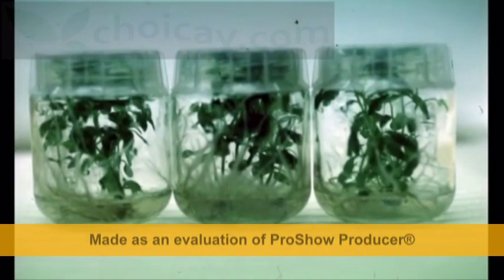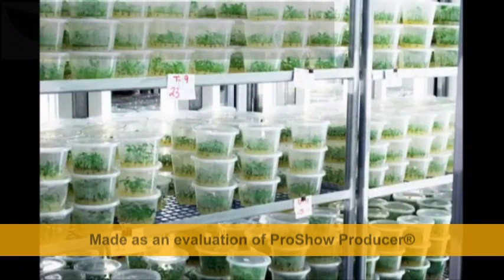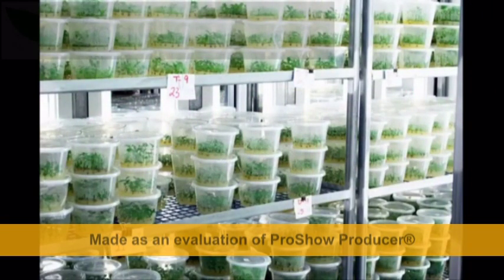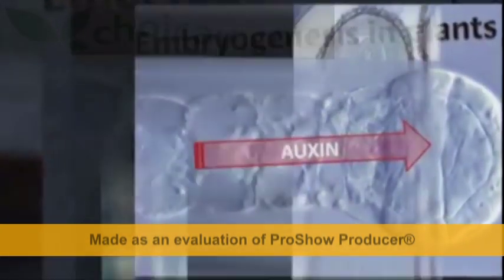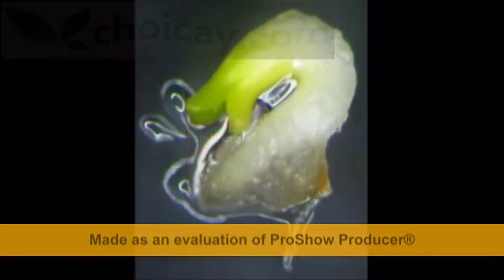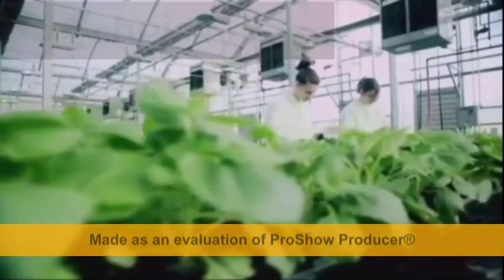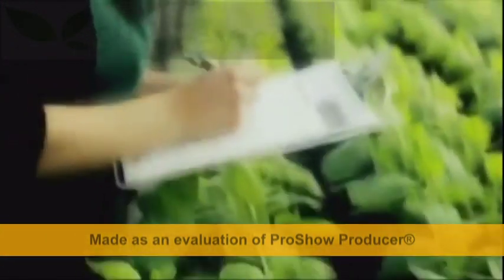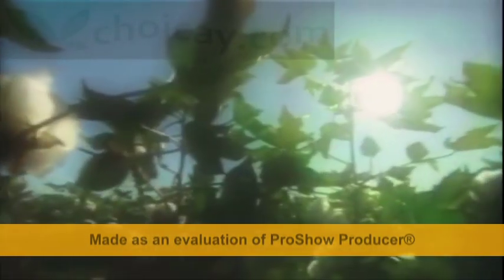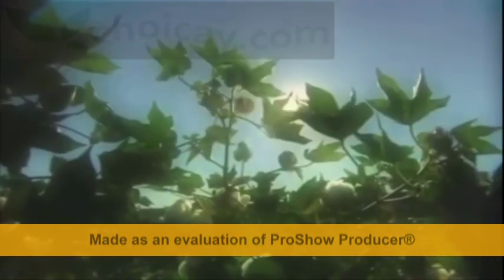An example of tissue culture is micropropagation, which involves plants growing in a medium under sterile conditions. Plant regeneration can be done by two different ways, either through somatic embryogenesis or shoot culture. The final step to complete a tissue culture is the transferring to soil and hardening of the plantlet. The hardening process is indispensable for the in vitro plant to adapt to external environmental conditions.